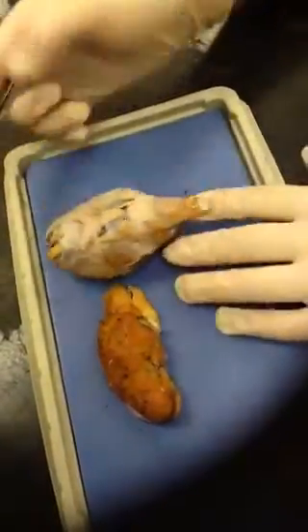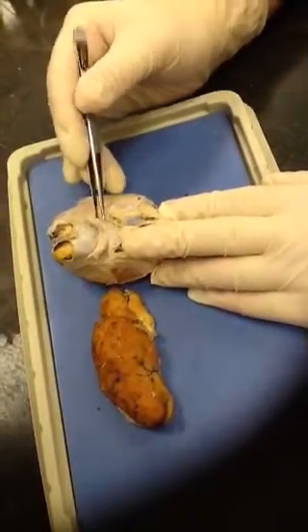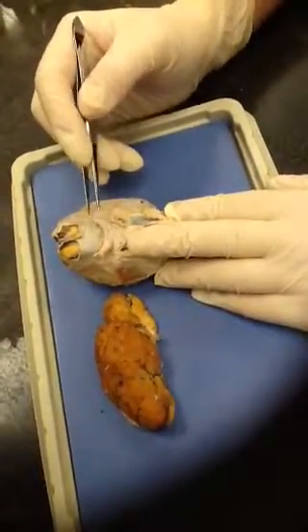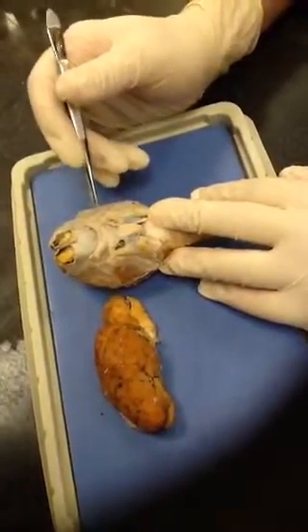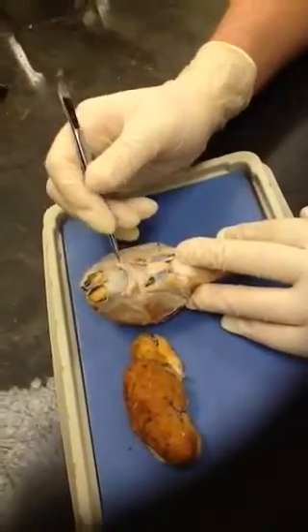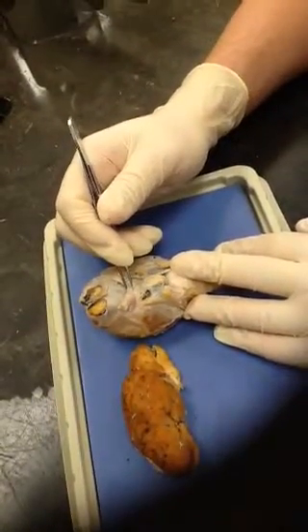The last couple things are nerves. So we have your optic nerves down here, okay, 1 and 2, for each eye. Now, your eyes are processed in the different side of the brain. So your right eye is processed by your left brain, your left eye is processed by your right brain. Okay, so that processing, that switching takes place right here where they come together at the optic chiasma.